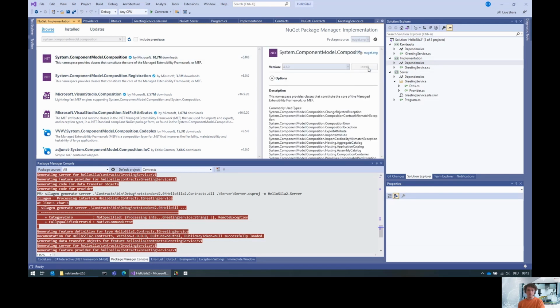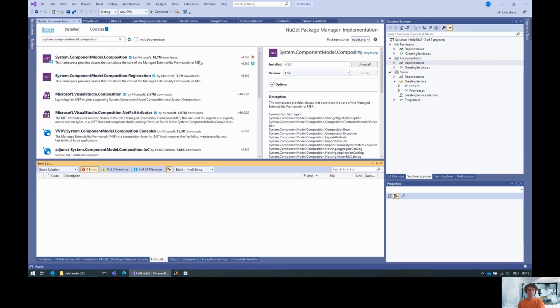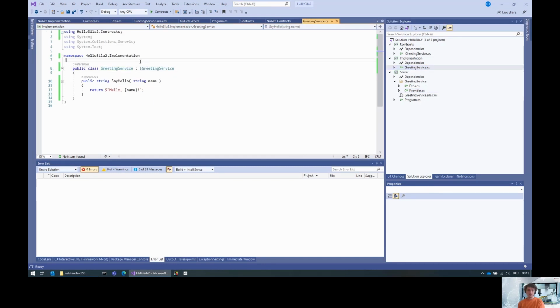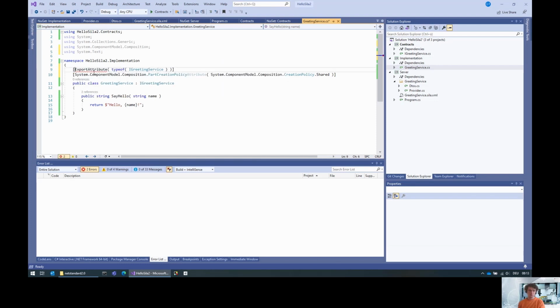We can also use the 4.5, I think, that is installed in the other projects. Yep, there. And then you can more or less copy those two lines here. And of course, we are exporting an iGreeting service. So maybe we can also make this a bit more beautiful.